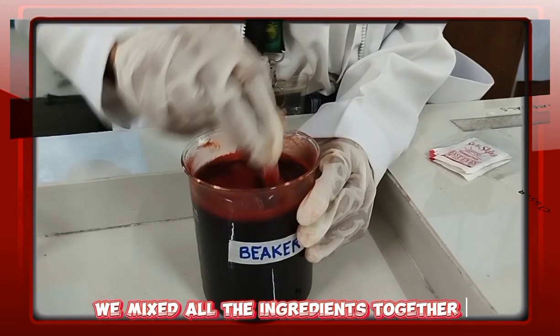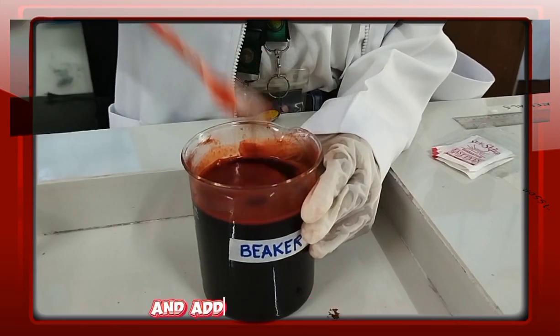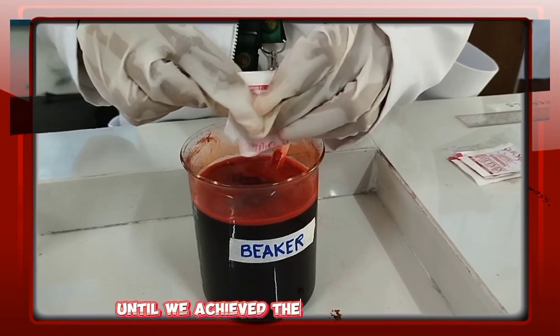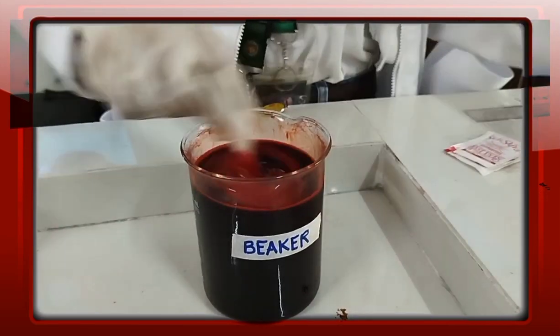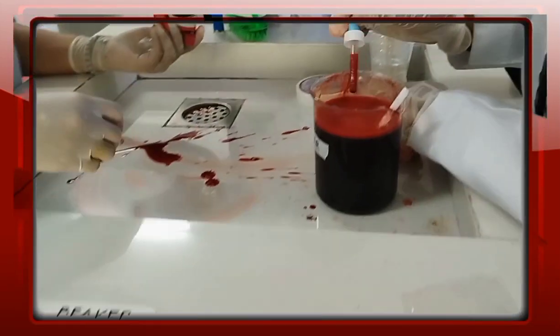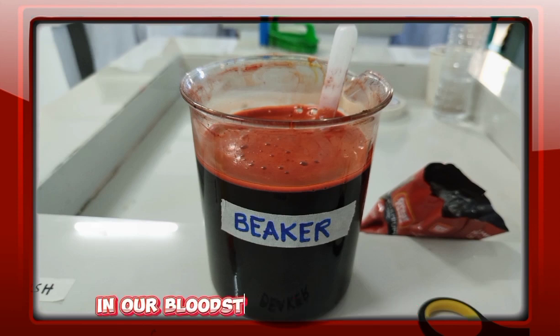We mixed all the ingredients together in a 500 milliliter beaker and added 500 milliliters of water. We stirred and mixed the mixture thoroughly until we achieved the desired viscosity. And this is now the fake blood we are going to use in our bloodstain pattern analysis.